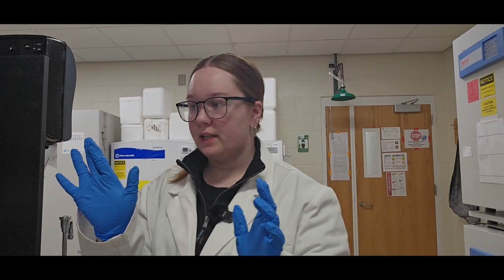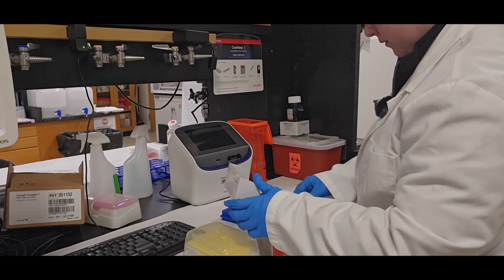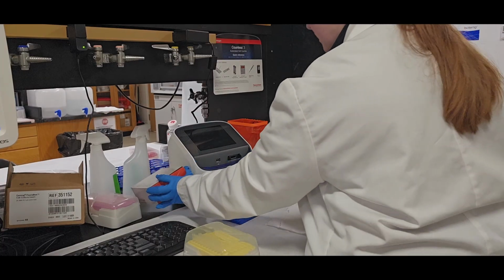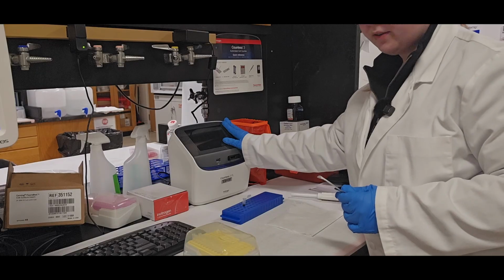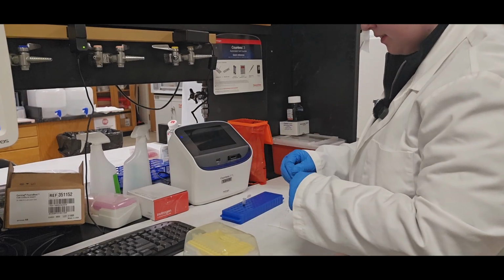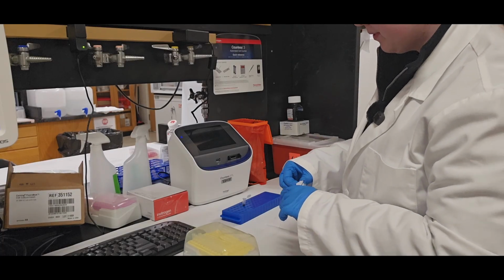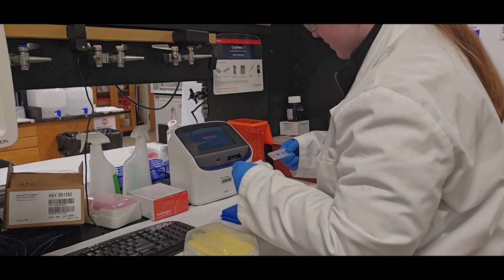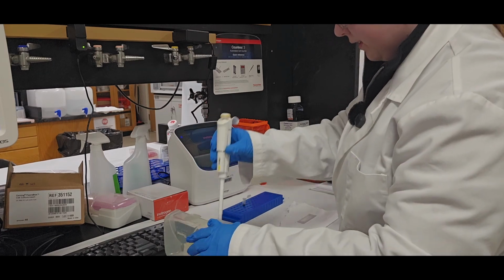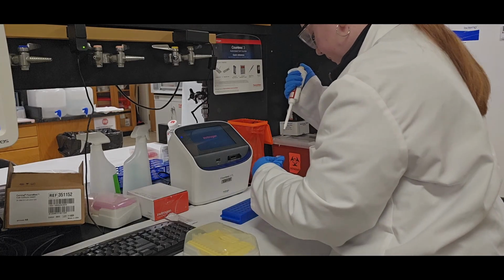So pretend like we didn't count that at all. We keep cell counting slides out next to this automatic cell counter that's located here. You turn it on the back. And unlike that hemocytometer, these are disposable. So once I'm done counting on this, I would put it in the biohazard. For this one, same thing. 10 microliters we're going to measure out.